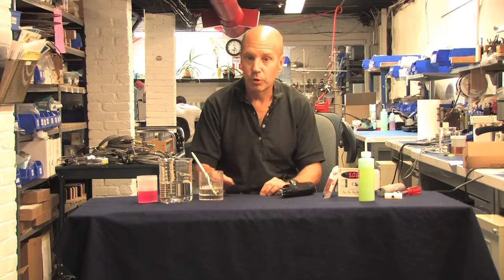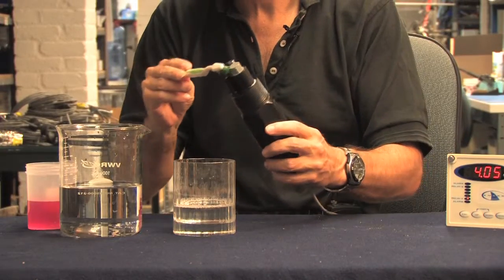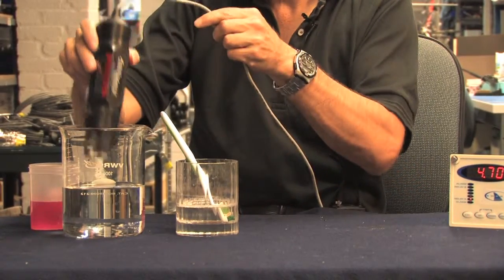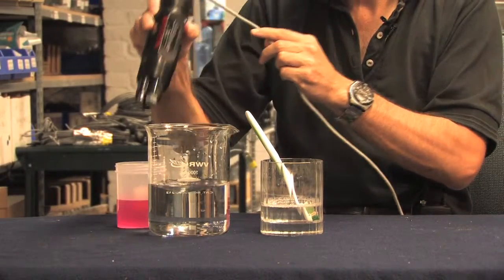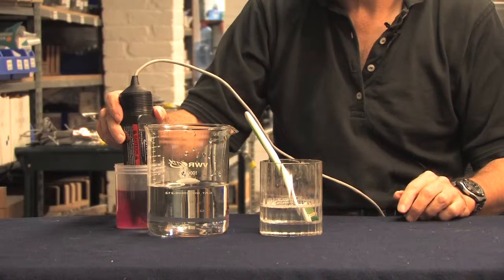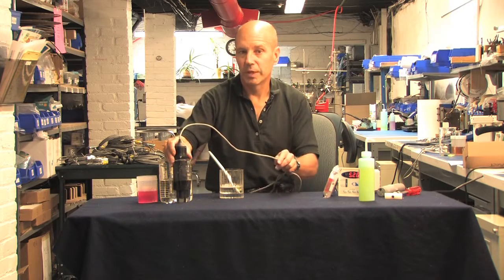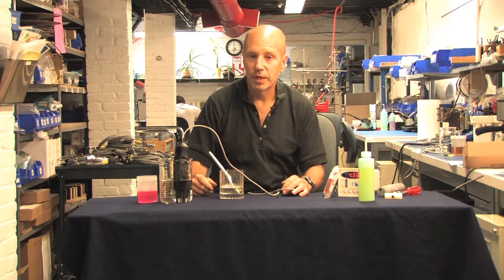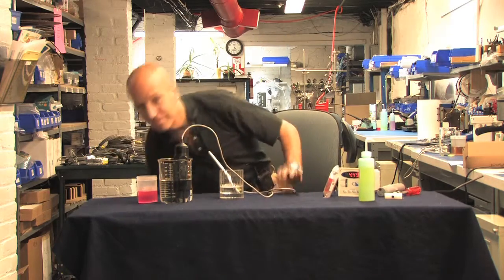When you calibrate your probe, you should clean off the bulb simply by brushing it with a toothbrush dipped into mild detergent, then rinsing it in water, and followed up with a rinse in pH 4 buffer or a weak acid. Now, if the probe continues to show a weak response, a weak acid will clean off scaling and organic deposits. White vinegar for about 4 hours should do the job.